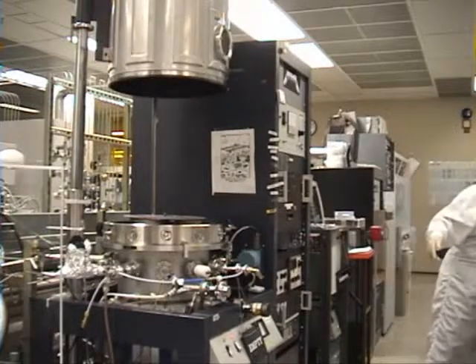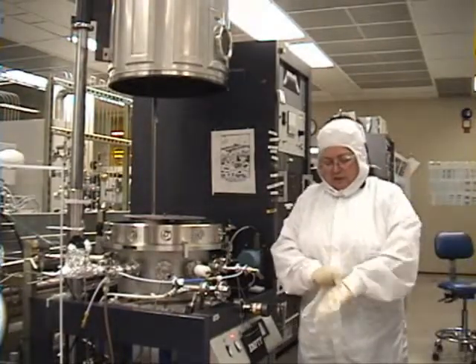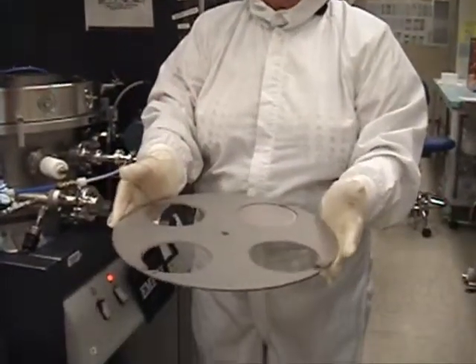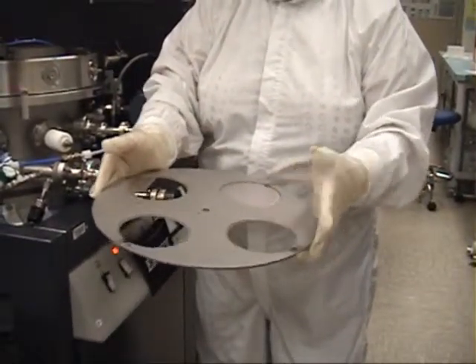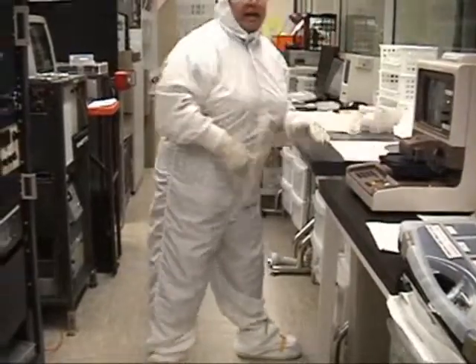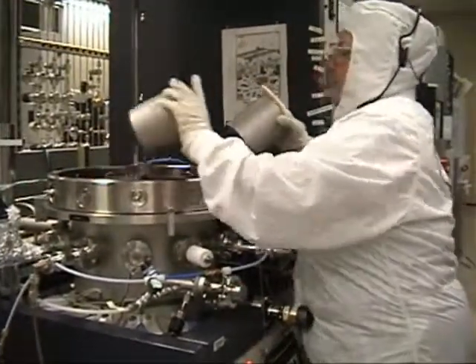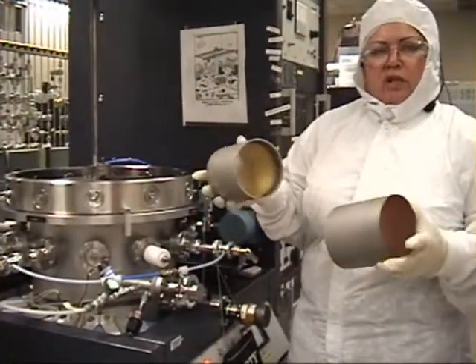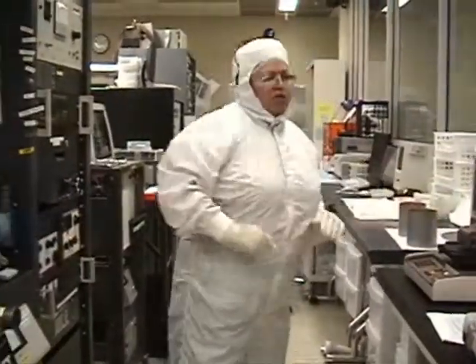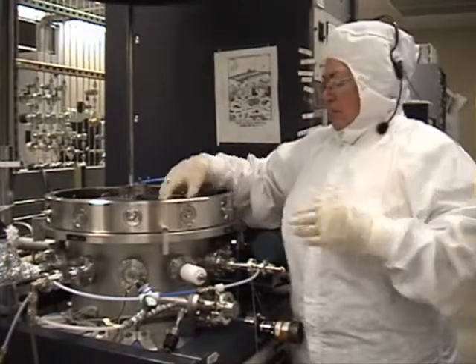To be able to remove your parts, you're going to make sure you have your vinyl gloves on. You have four inch or 100 millimeter slots. One carries a dummy wafer. We're going to set it on the table where we have clean wipes. You have two chimneys. You're going to inspect to make sure that there is no peeling or bubbles. You're going to also set those on the clean wipe. On this machine, you can only sputter two metal, two layers.